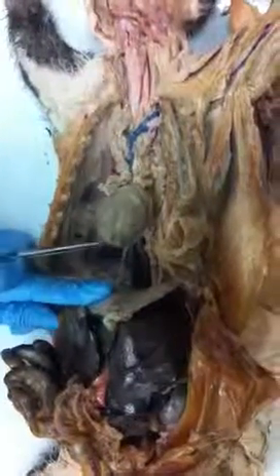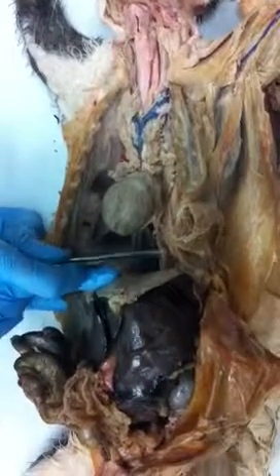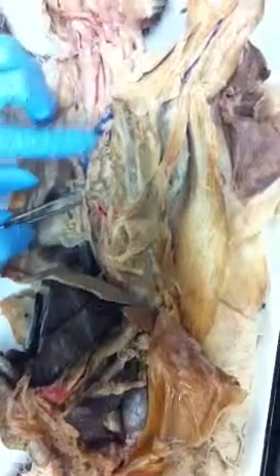and this white fiber right here, this white thread on this side. Here and here. Those are the phrenic nerves. You can actually follow those. Yeah, here it is. Phrenic nerve comes all the way up here. Goes all the way up. That innervates the diaphragm and allows your diaphragm to move all the way down.